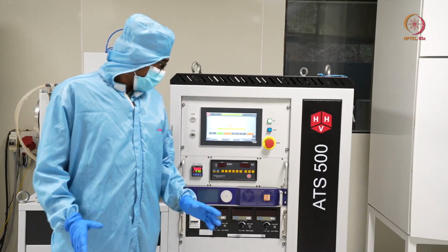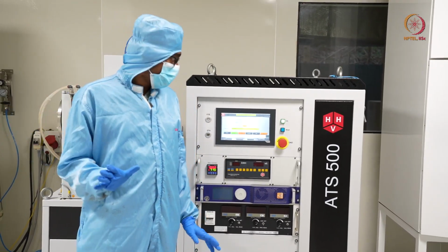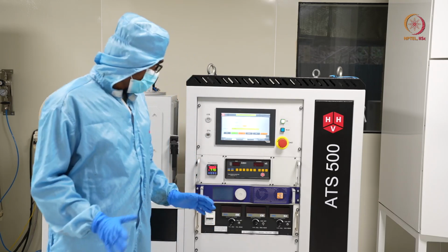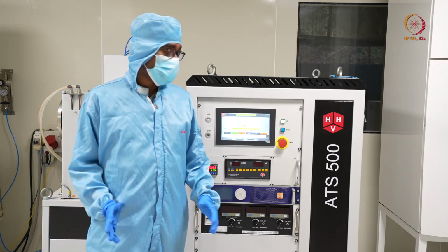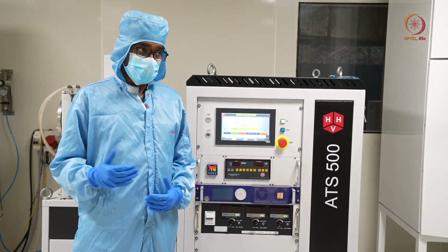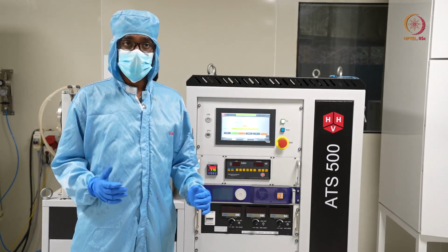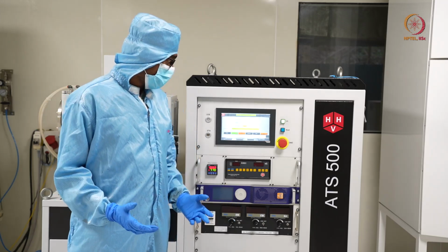So by that time it is creating some vacuum. By the time our gas flow is off already, though the valve was off, so gas flow was not there inside the chamber, but still it is better to be off. Here we can see the roughing pressure is around 1.7 e power minus 2. So it started evacuating the chamber, but we should keep at least e power minus 3 or e power minus 4 pressure. That will take some time, maybe 10 to 15 minutes or 20 minutes.